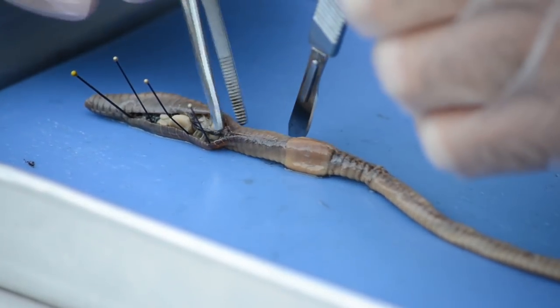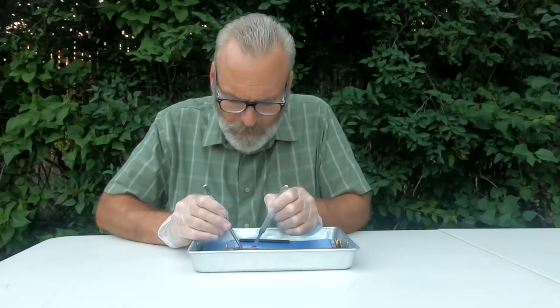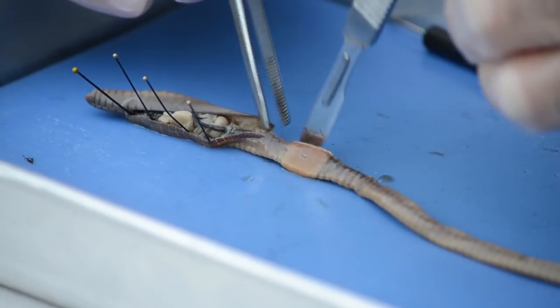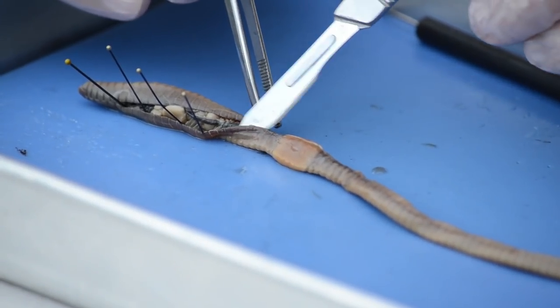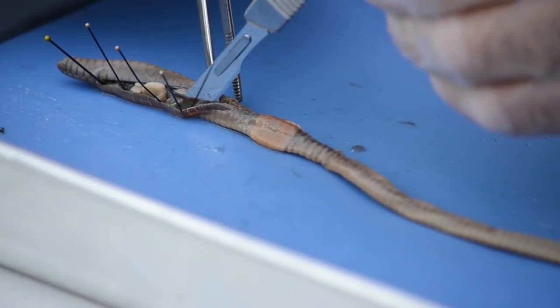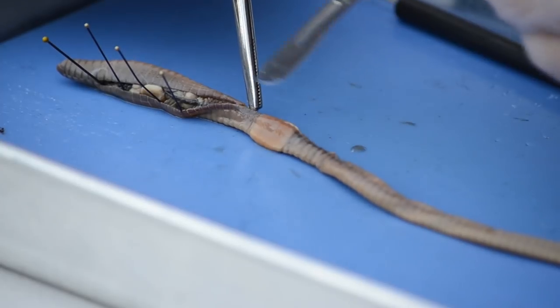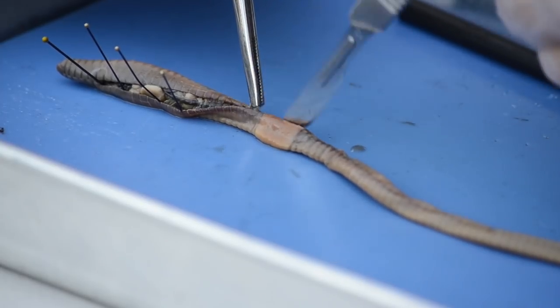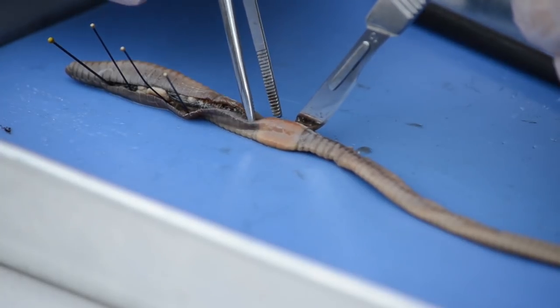I know I'm moving this around a little bit. There's the intestine right there. I've also cut through that before, so just be really, really careful the best you can. We'll try to get through this without too much damage to the digestive tract.